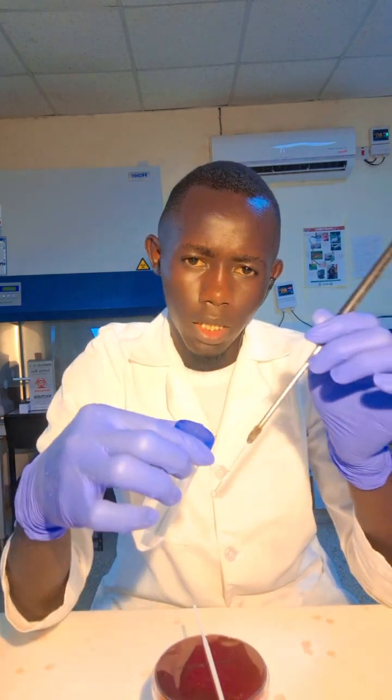I'm going to use, you can use either the plastic or the metal one, that is the wire. This one is reusable. So I was talking about the principle of this streaking method. You pick a sample by using the wire loop. For example, we can have a sample like this one. Let's say this is our sample. So you immerse this wire loop into the sample, the diluted sample, that is. Then you just pick the loopful.